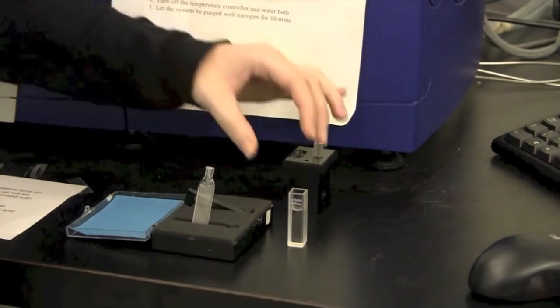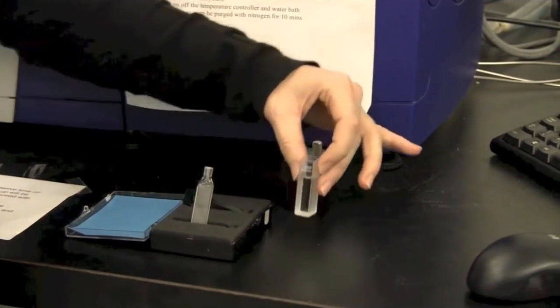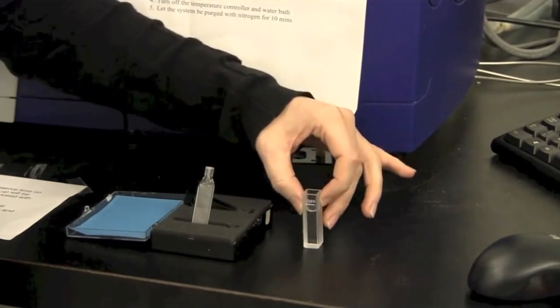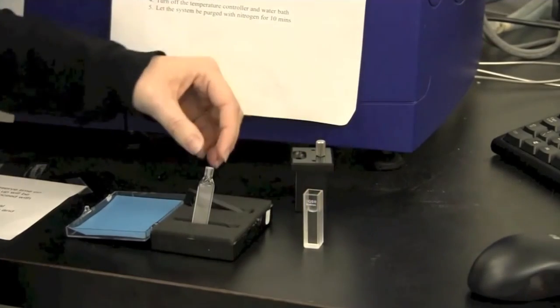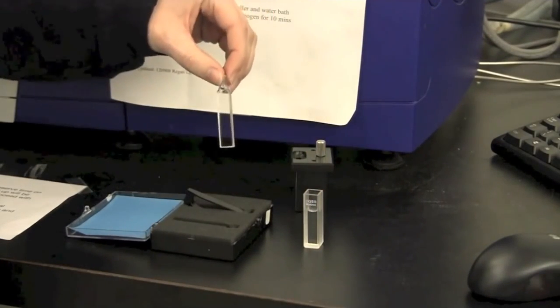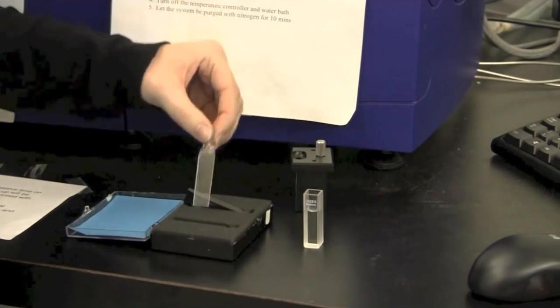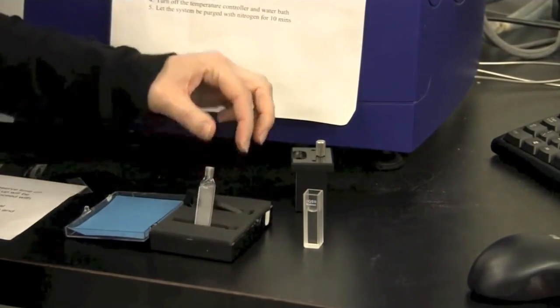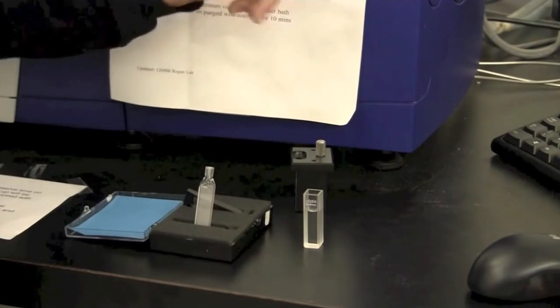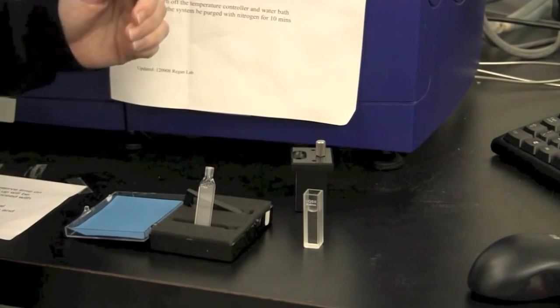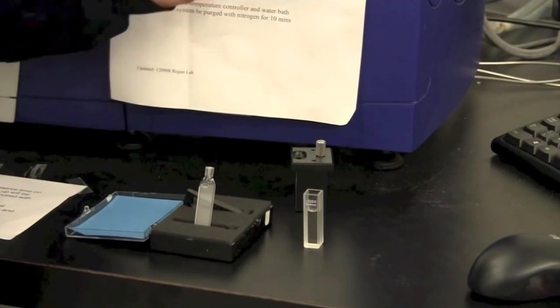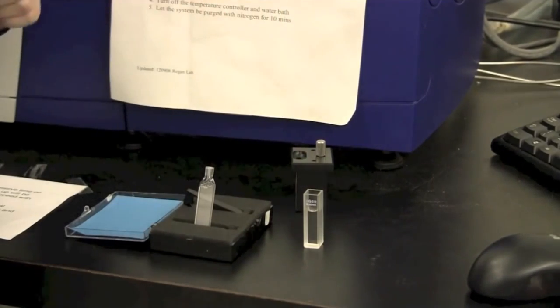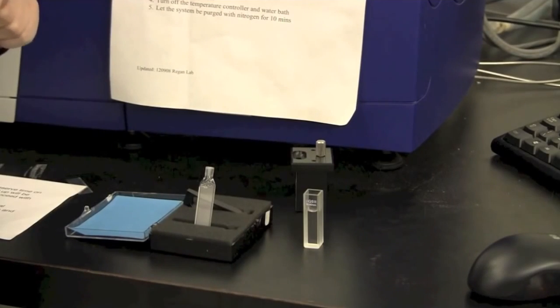You have different options of path lengths. You can use a 10x10 cuvette like this or you can use a shorter cuvette for instance at 0.5 mm like this one. Since most buffer systems are based on water I have made sure to use water here for my demonstration.